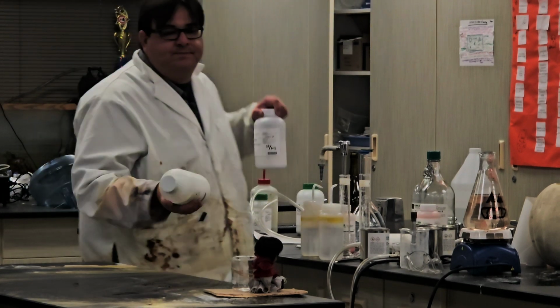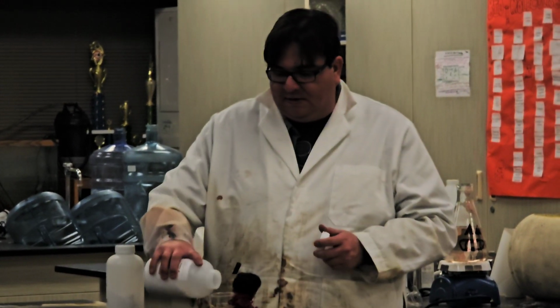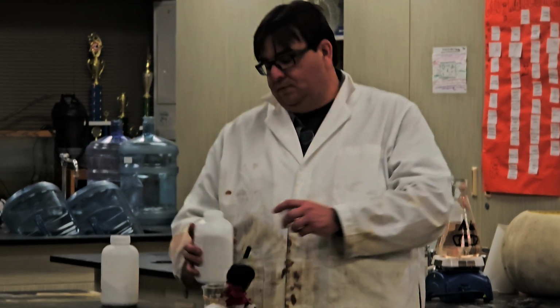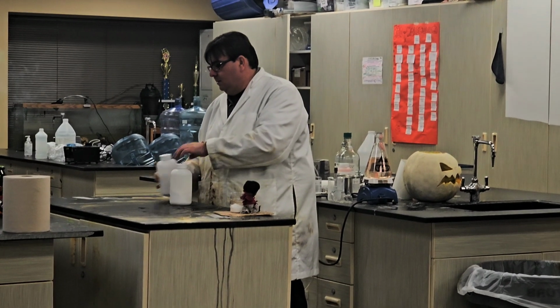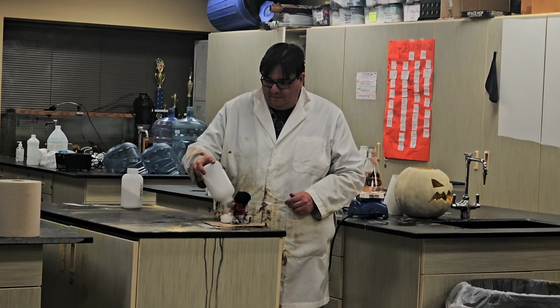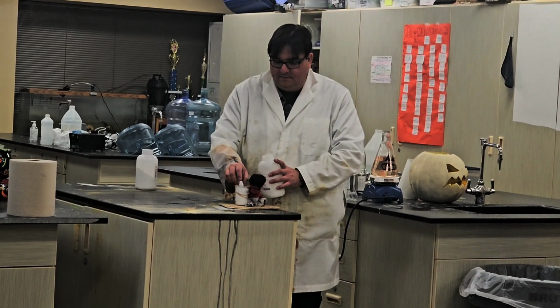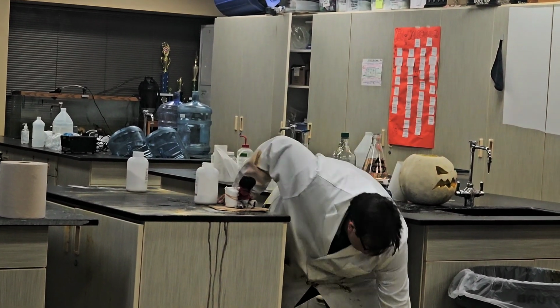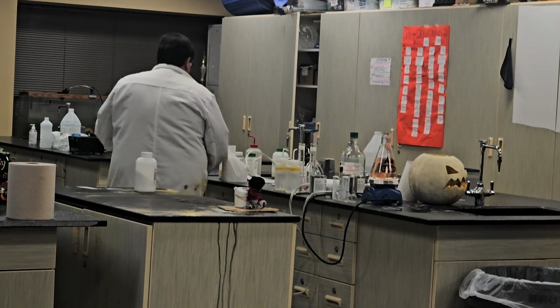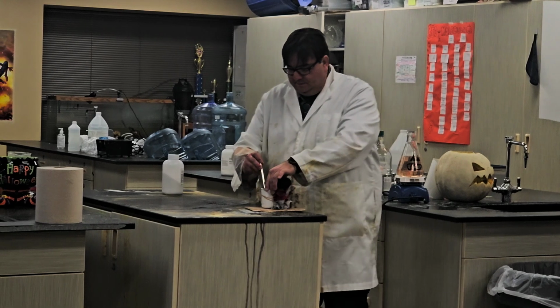Bang things on the table. So, I'm going to take some of these crystals. Ooh, that was way too much. Then I'm going to mix these together.